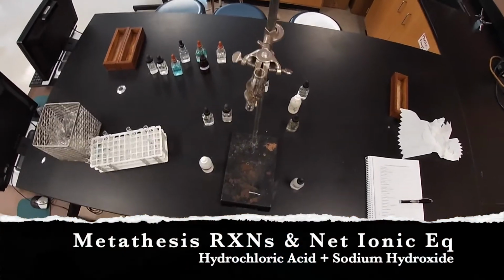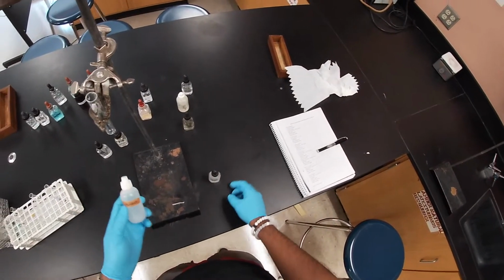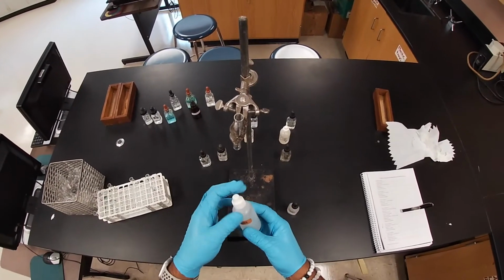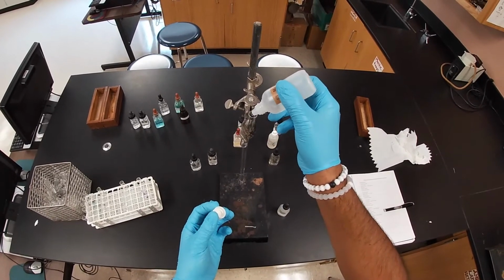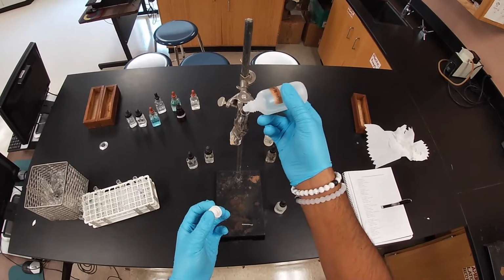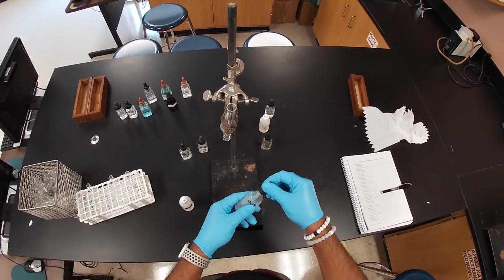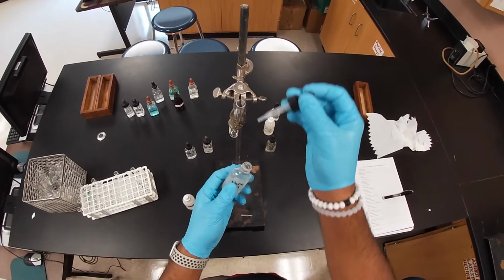Next reaction is going to be between hydrochloric acid and sodium hydroxide. Remember that hydrochloric acid is an acid, and sodium hydroxide is a base. And so, let's see what we see here. Going to add about 1 milliliter, give or take, hopefully. Shake it a little bit. Going to go ahead and add our sodium hydroxide now.